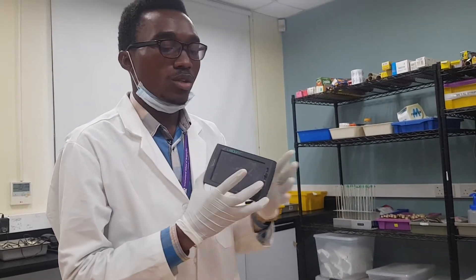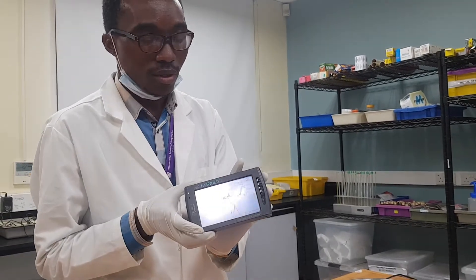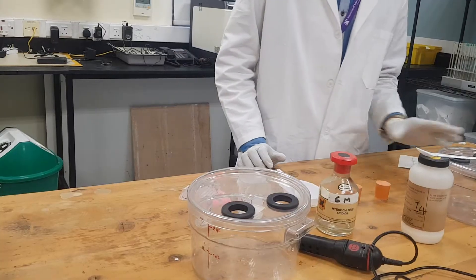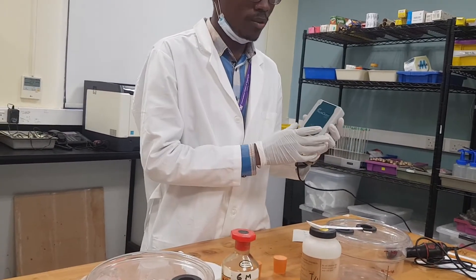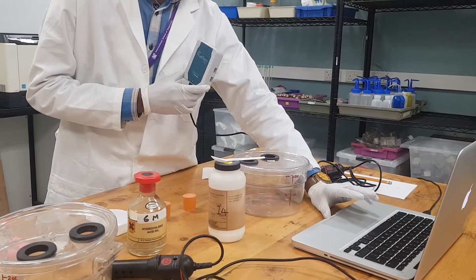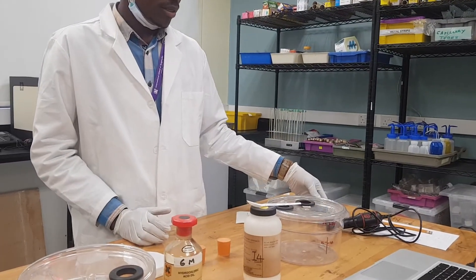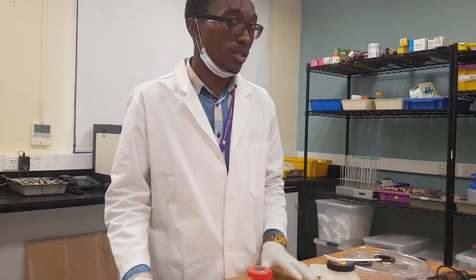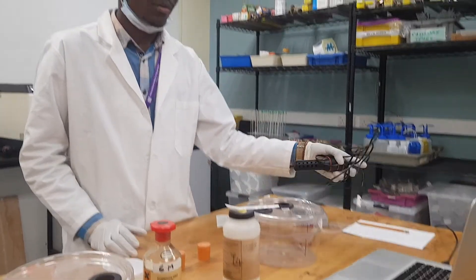If you're going to use this LabQuest 2, you don't need to use a laptop because it has a screen that can display the same thing as what would be displayed on our laptop. Also, when you use the LabQuest Mini, you need to have a certain app called Logger Pro already installed on your computer.